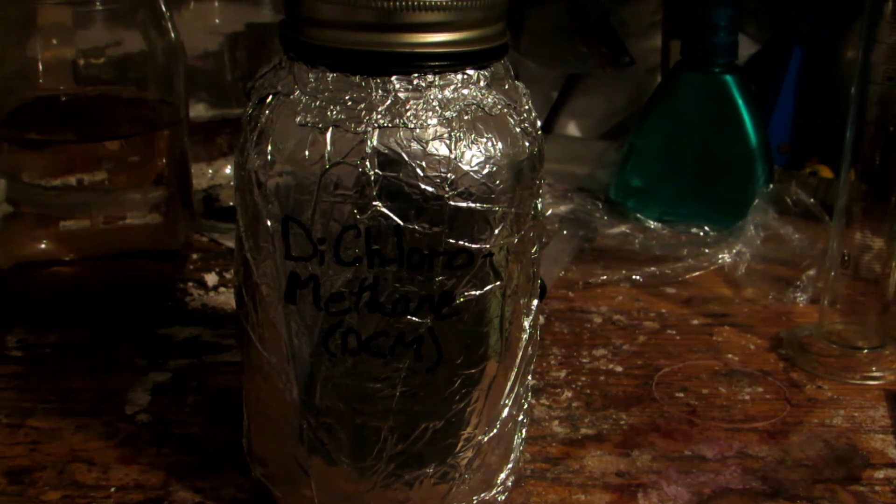Because we did this distillation outside at about 4°C, the dichloromethane is very cold and will rapidly warm up inside at about 20°C. Over the next morning, just make sure you open the lid to prevent a huge pressure build-up — you don't want a glass breaking. That's basically how to get dichloromethane from paint stripper. Hope you guys enjoyed, bye!